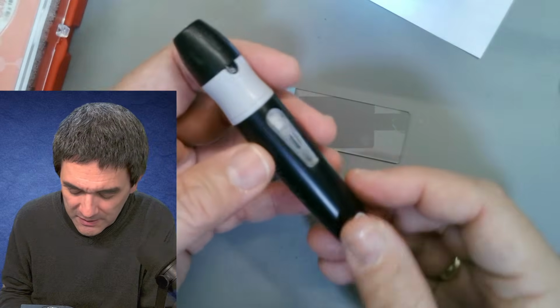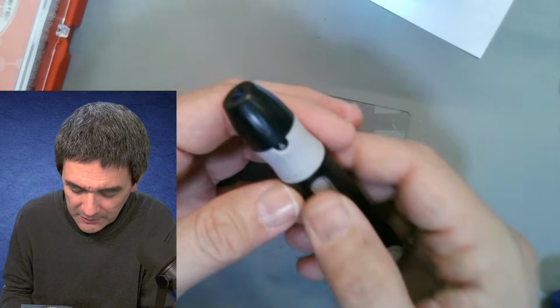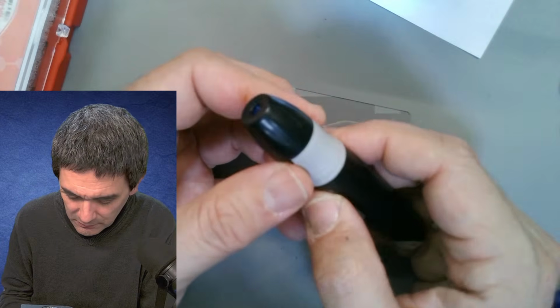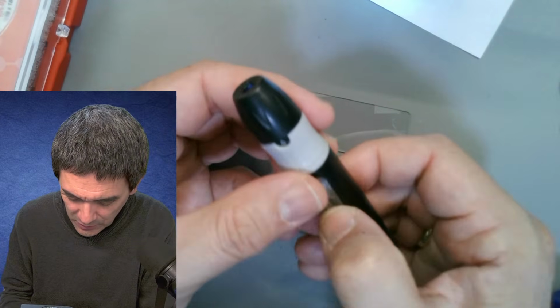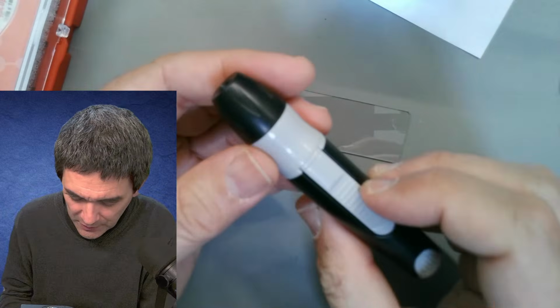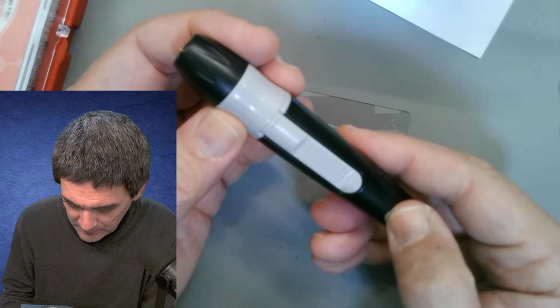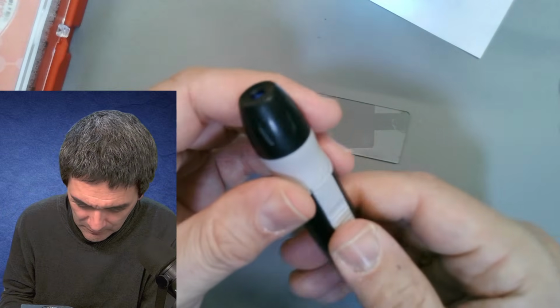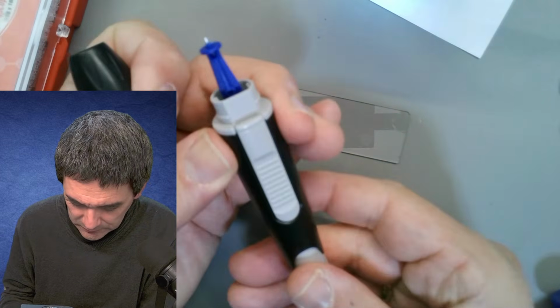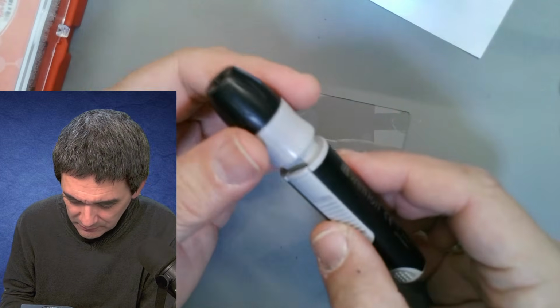And then I basically have to load it up, and then if I press this button here, where is it? See, it doesn't work. Why is it not working? That's interesting. Ah, now it is.